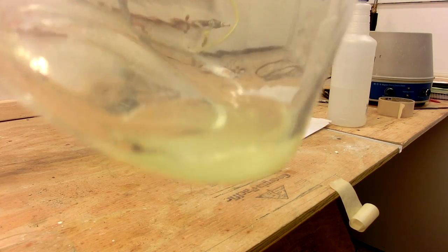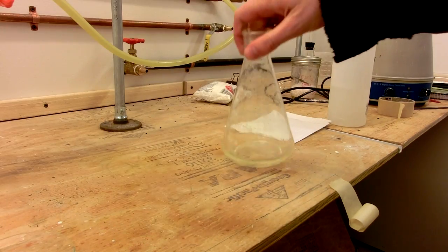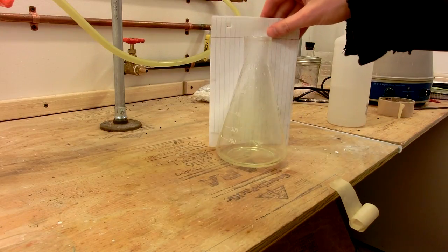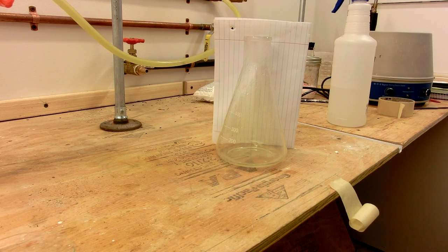And you can see by the effervescence of the liquid inside that the hydrogen carbonate is being converted into carbon dioxide, sodium chloride, and sodium hypochlorite.